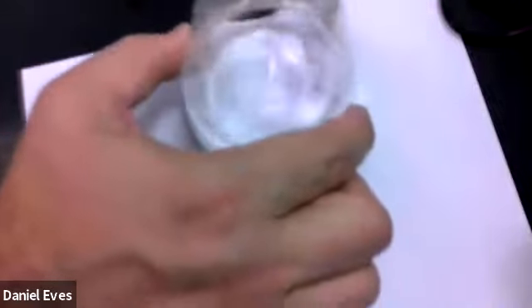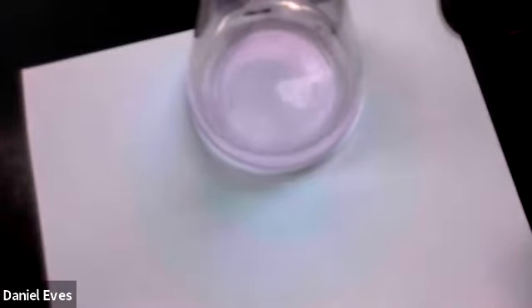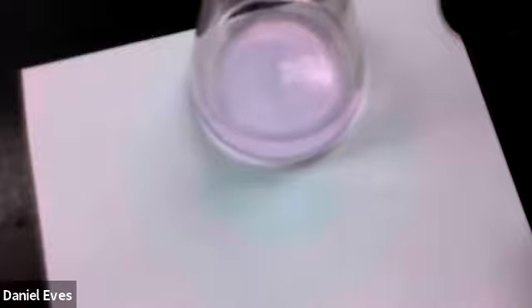No, not quite. So stop there and see if it's persistent. It is persisting. Okay, we have reached it. Okay, so we started off at 0, and here we are at 35.5. Wow. Okay, well, there we go. 35.5 milliliters was our endpoint. We started at 0, so 35.5.